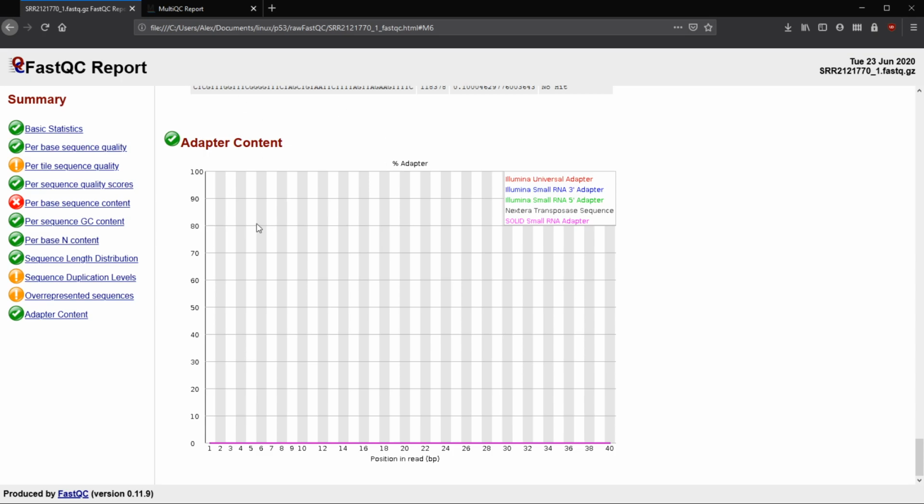And finally, we have our adapter content. So this is looking for Illumina or whatever adapters that you're using to see whether or not they're present in the sequencing results that you have for this particular library. So it's going to look for all of these adapters to see whether or not they're present at any base pair or any base call location. This gives you a good idea of whether or not you have to adapter trim your sequences.